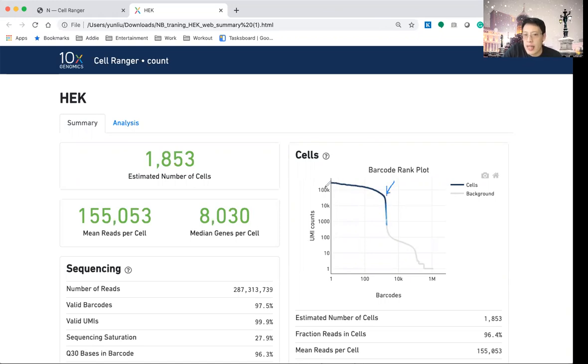And what I want to see here is that it's pretty plateaued, it gradually goes down, but there's a sudden drop. So what this means is the X here is the number of barcodes. If I move my mouse over here, you can see there are maybe somewhere around 5,000 barcodes where we received a number of reads or UMIs above a certain number. And this tells me that about 100 cells have UMI numbers we detected of about 100,000 reads, very excessive. And then this number will go down gradually.